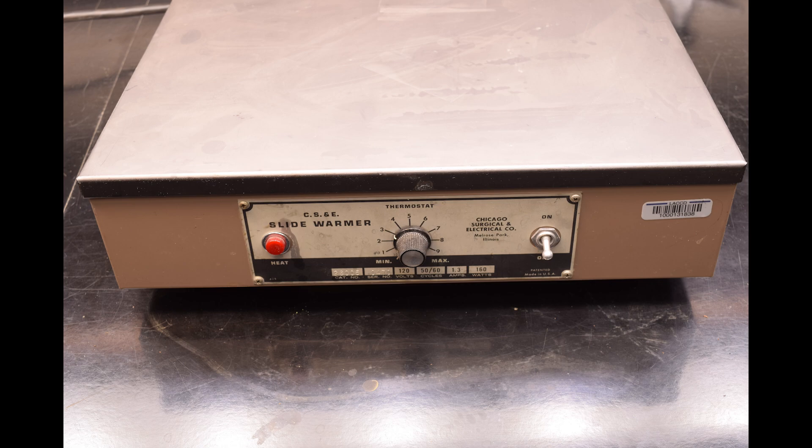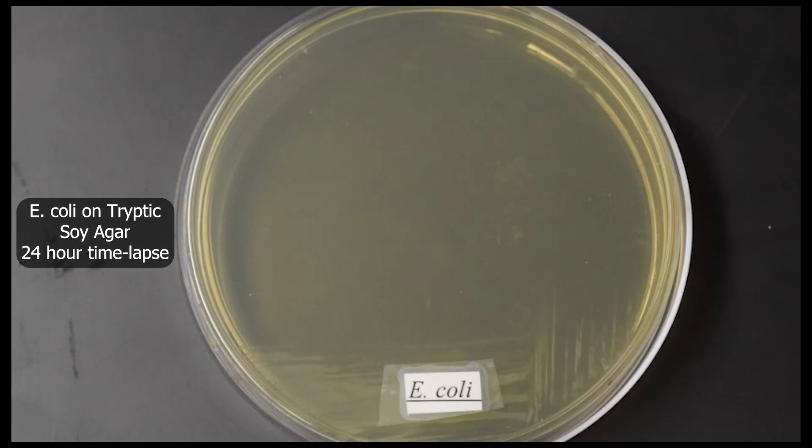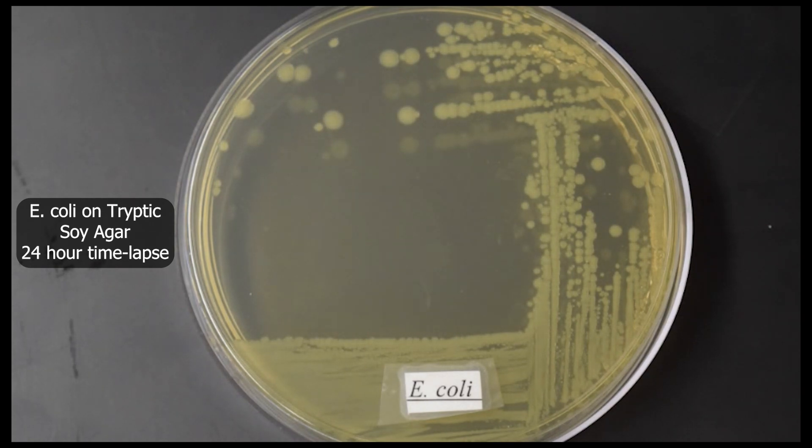I adjusted the temperature on the slide warmer until the media was at the optimal growth temperature for bacteria. Then I placed new media inoculated with bacteria on the slide warmer and started taking time-lapse pictures. This resulted in these beautiful time-lapse videos that brought life to these classic experiments.